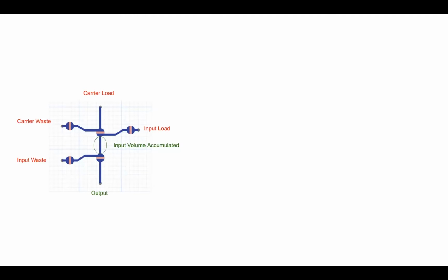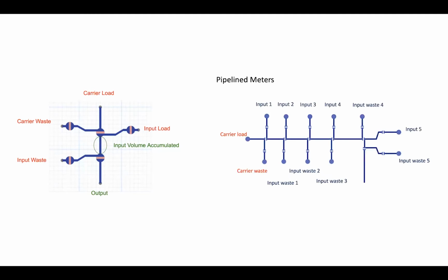This is a meter component design in 3DuF. It takes input load and carrier load, and the excess amount of carrier and input will go to the carrier waste port and input waste port. When multiple meters are combined, it can be pipelined to only have one carrier load and one carrier waste, while having multiple input load and input waste ports.